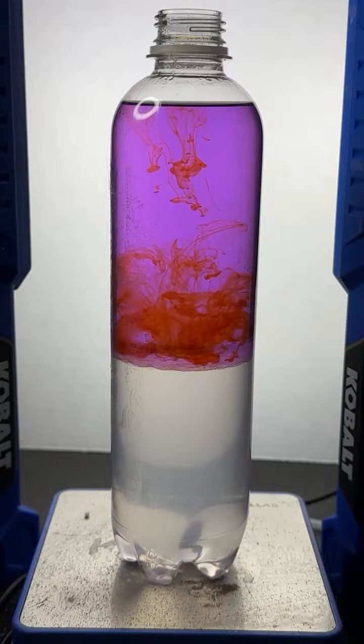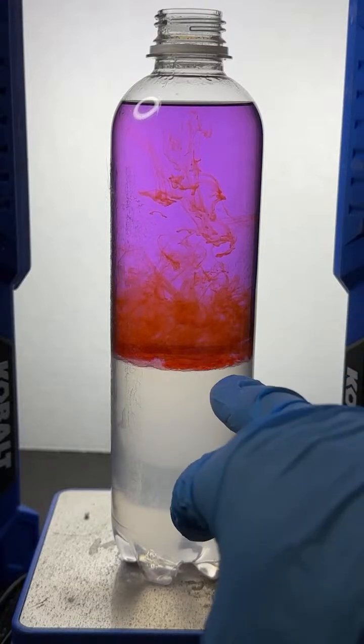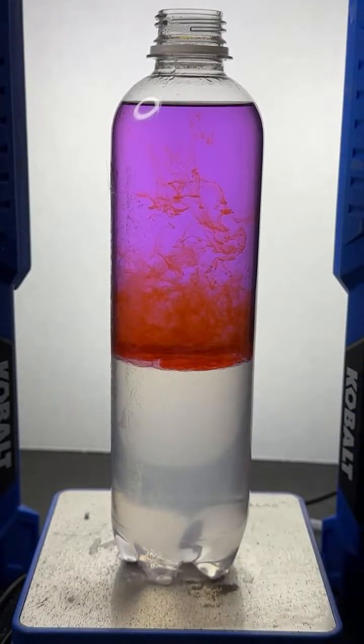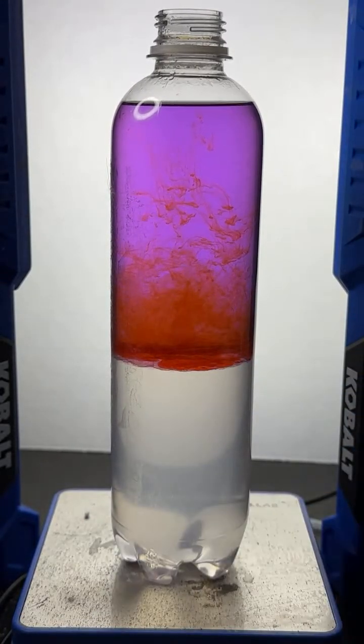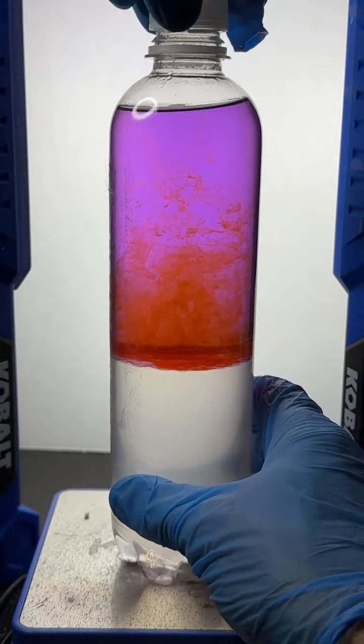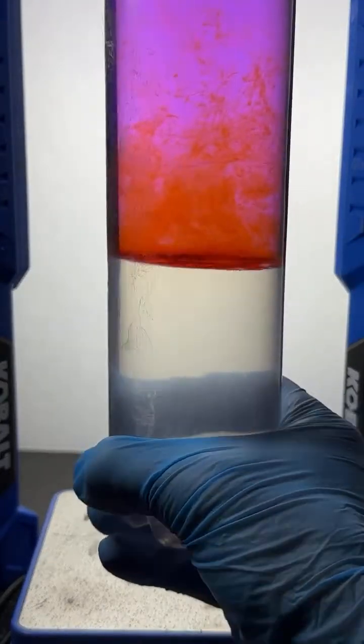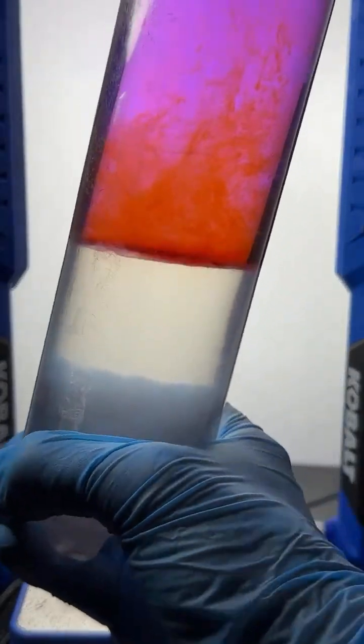And I'm expecting that not to penetrate the saltwater layer, because the density of this is just too high for the dye to penetrate that layer. But there may be a dye in the pink that we can actually get to dissolve in the water layer. Let's find out. I'm not sure, but we're going to find out. We're going to mix all this up, and we're going to see what happens.